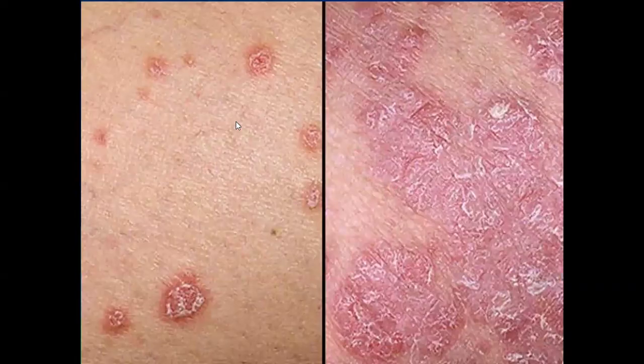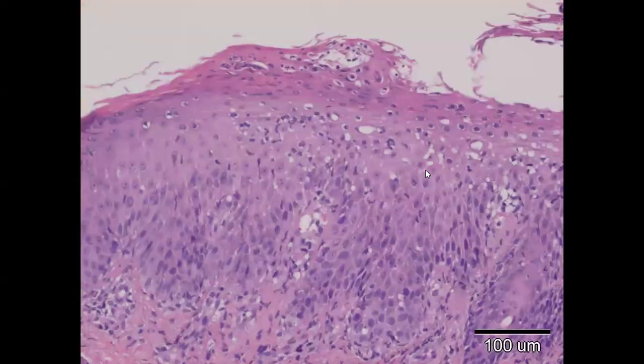This is another example of psoriasis, but now the psoriatic lesions are not in the form of plaques, but rather small disc-like papules or plaques known as guttate lesions, or guttate psoriasis. Guttate psoriasis is different clinically from plaque psoriasis, and histologically it will also be different because the lesions are small.